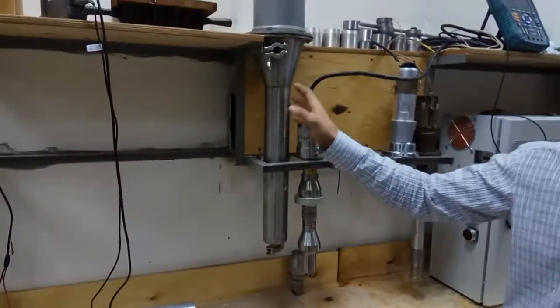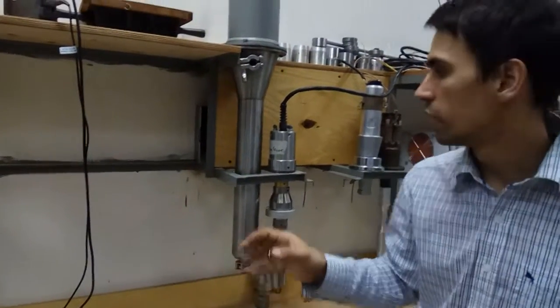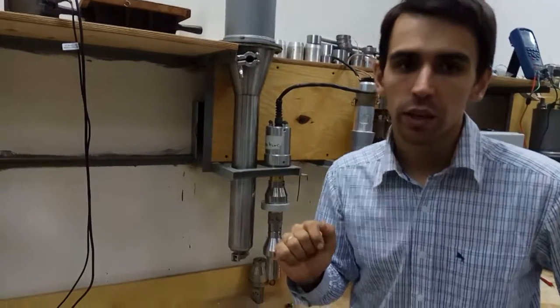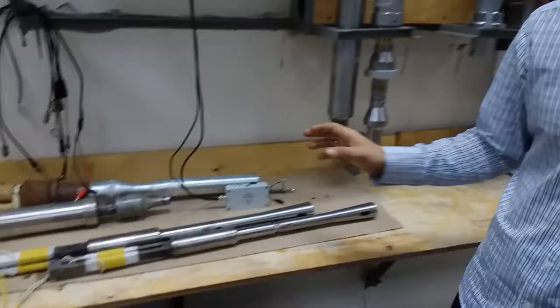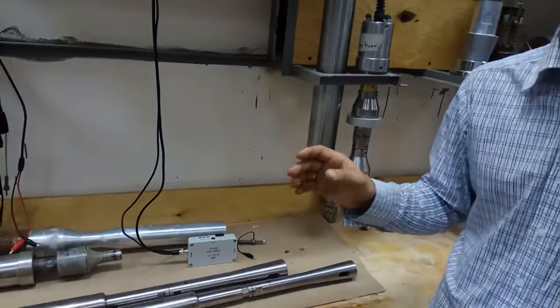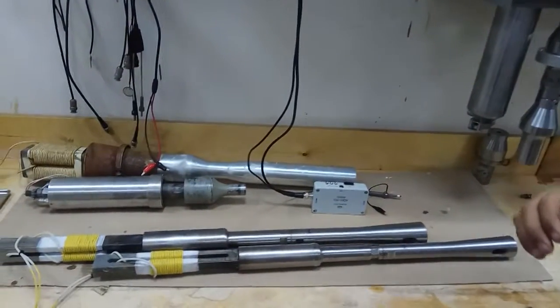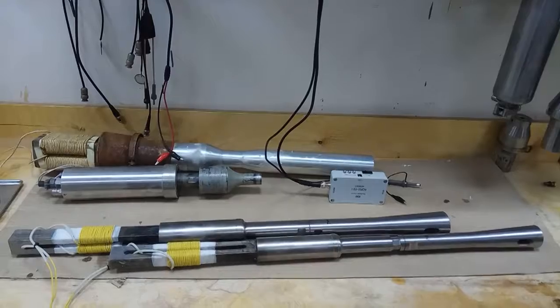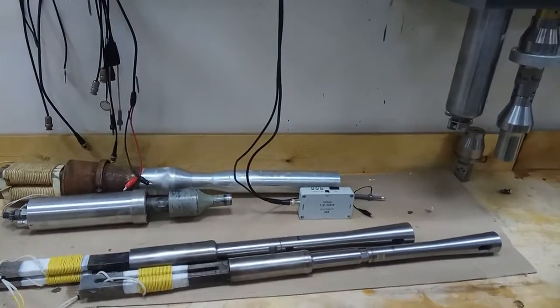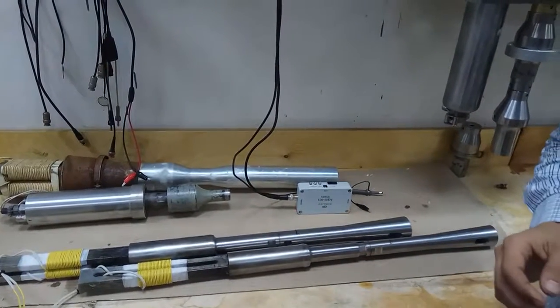Here inside is inserted the same tool. And 100 micron, I mean in liquid. It is this tool. It's made of a special titanium alloy that has undergone structural processing. The bar of special shape on the one hand and the ultra-fine grained structure of titanium on the other hand allow us to reach such amplitude.